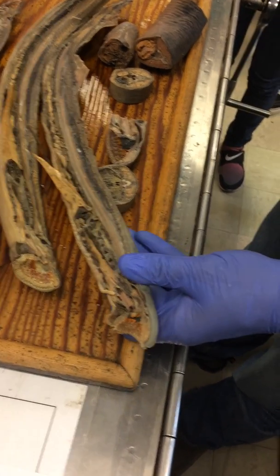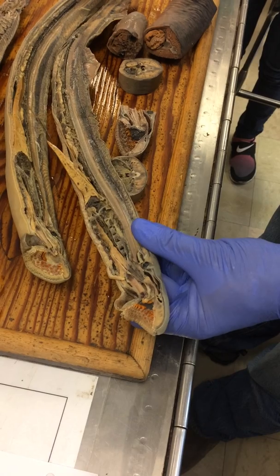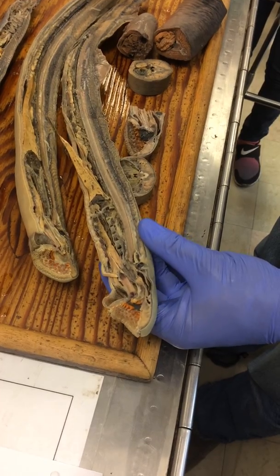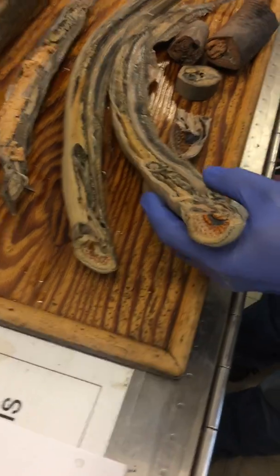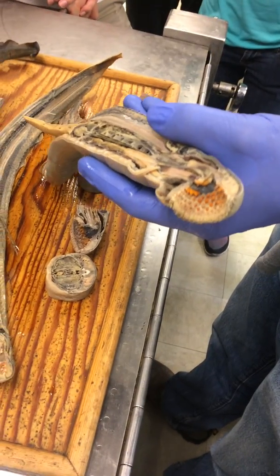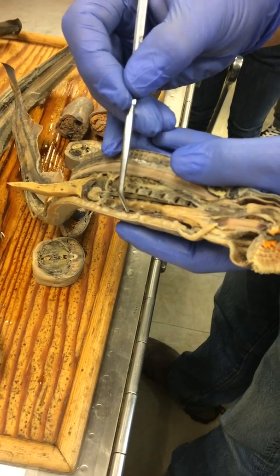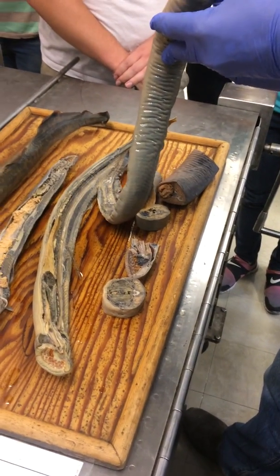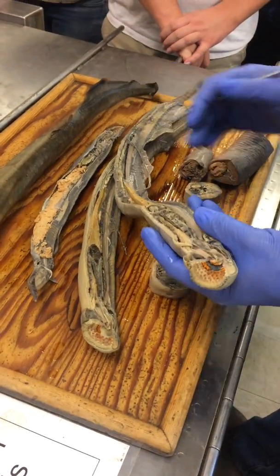There are some cartilages that support the head structures in these guys. Technically all the cartilages that surround the brain and the sense organs are known as the chondrocranium — chondro means cartilage, cranium means skull, so cartilage skull. There are also cartilages that surround the gill region or pharynx, and that's the branchial basket. You can see it as this dark stuff right below the gill region, and if you probe it with your probe, you'll feel that it's hard — it's not a soft structure. It's kind of dark colored in these guys for reasons I don't know.